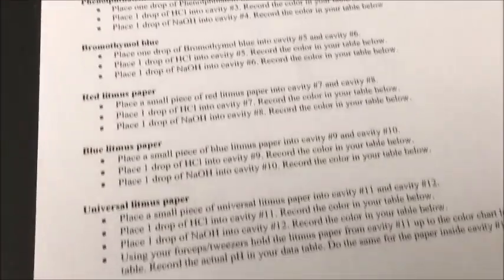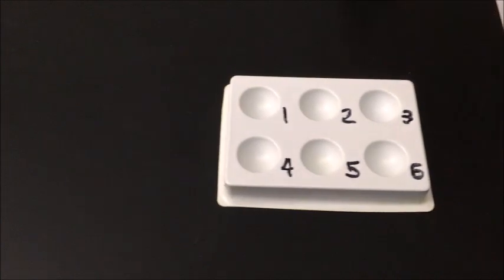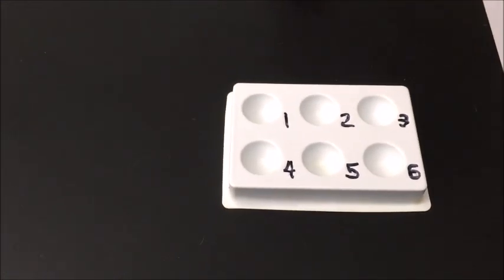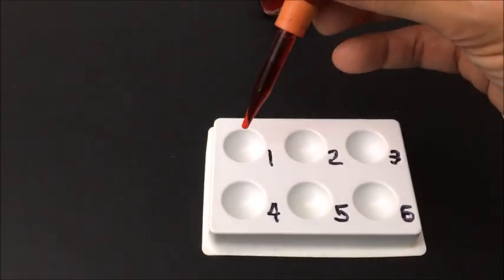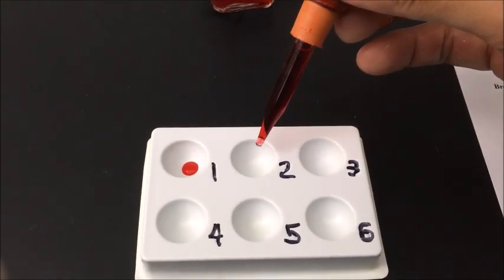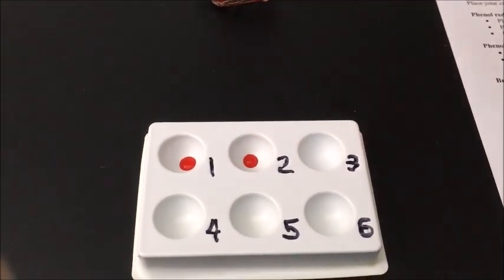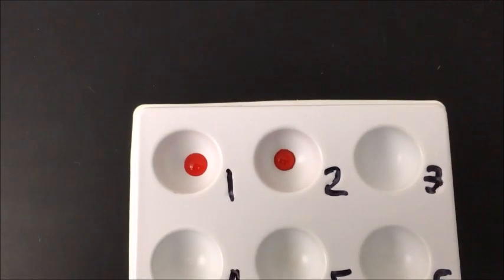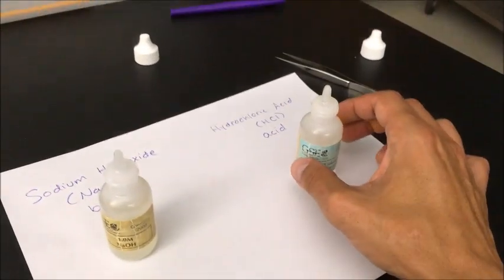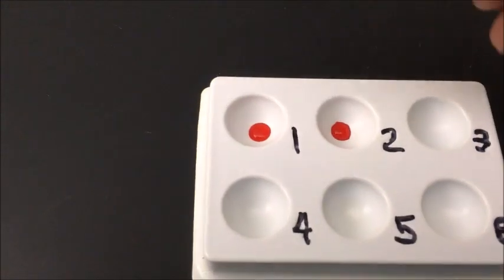The first indicator I'm going to test is a chemical called phenol red. Phenol red will indicate if something is an acid or a base by turning colors. I'll add a drop of phenol red into cavity number one, and then a drop of phenol red into cavity number two. Now I'm going to take my hydrochloric acid and add one drop into cavity number one to see if there's a color change.